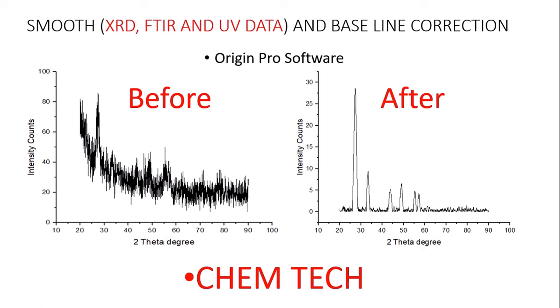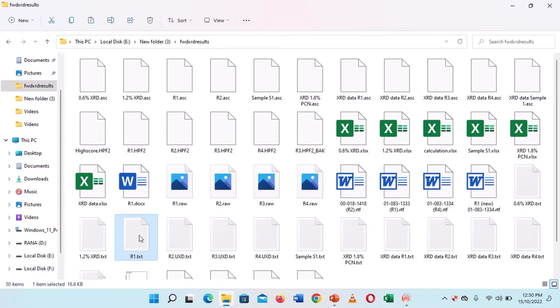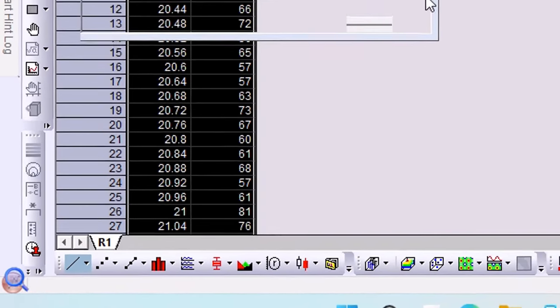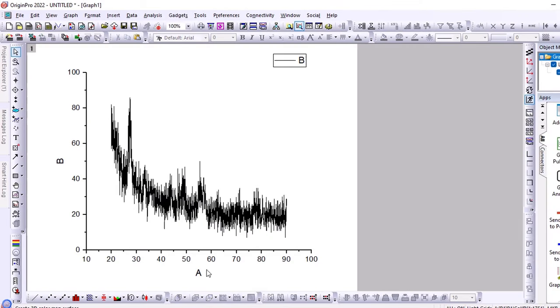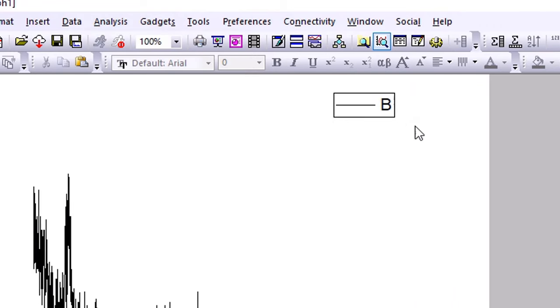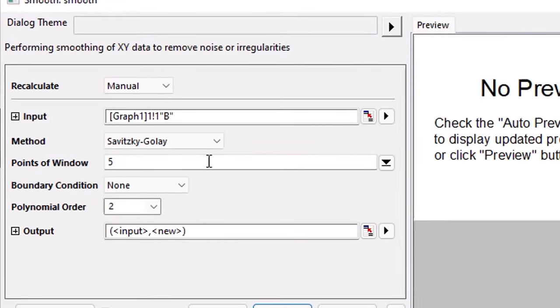First of all, let's open the Origin Pro software. I open the Origin for this. Now I need to smooth this file. I open it in Origin. Now I select the graph and convert it to a graph. This is 2 Theta Degree and this is my Intensity. Now I select Analysis, Signal Processing, Smooth, Open Dialog. If your data is smooth and you can correct the baseline, then you don't need to do this step.